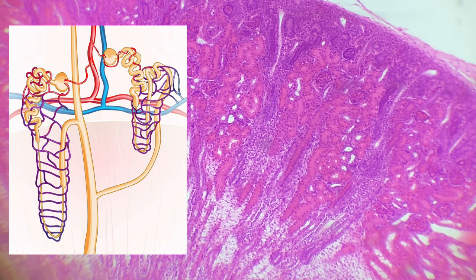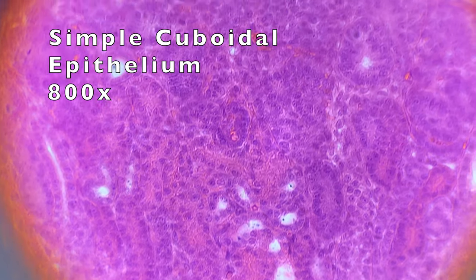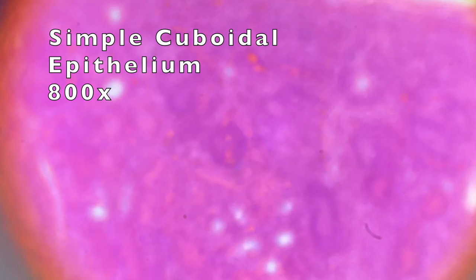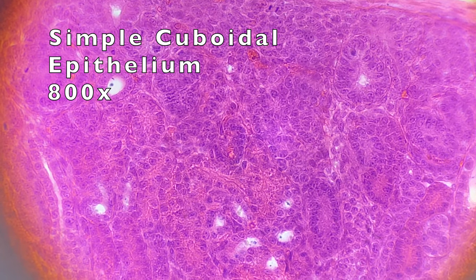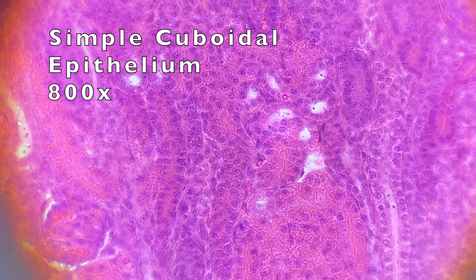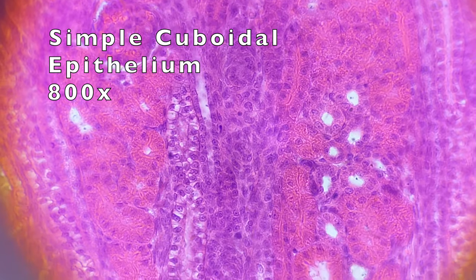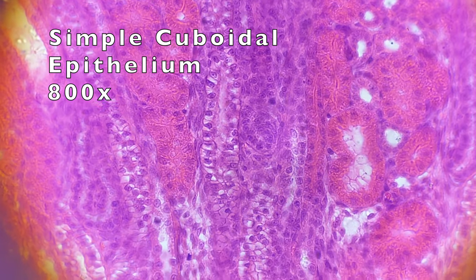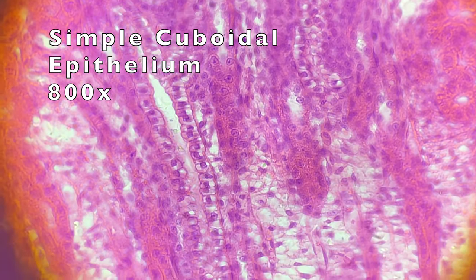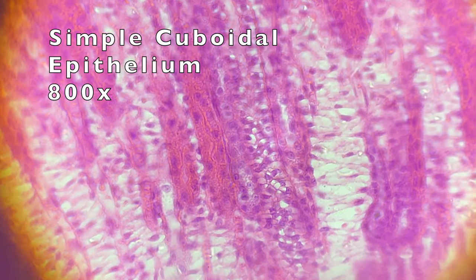If we zoom in and focus on the pink region, you can see that all of the cells are kind of cube-shaped — and that's why they're called cuboidal epithelium. The 'simple' part of that means there's only one layer of them. Multiple layers would mean stratified.